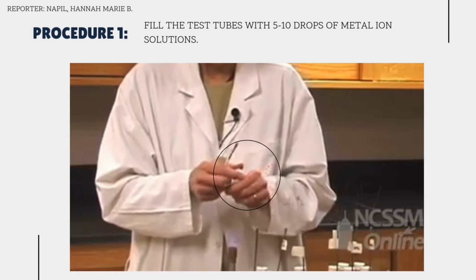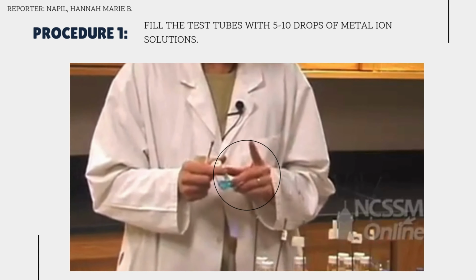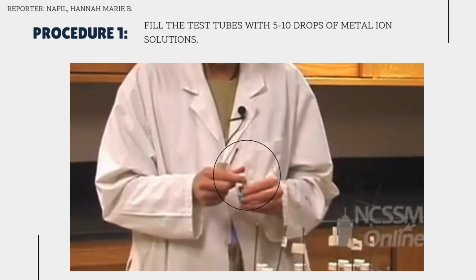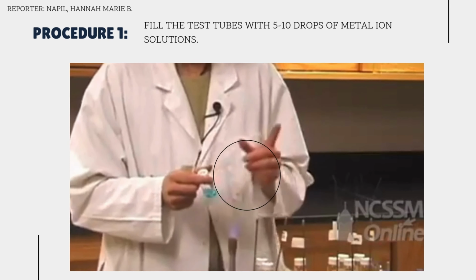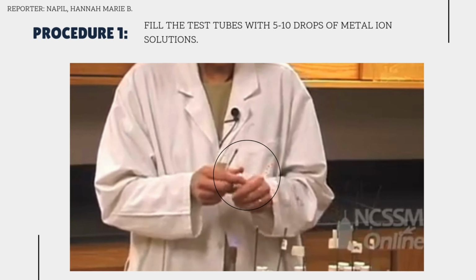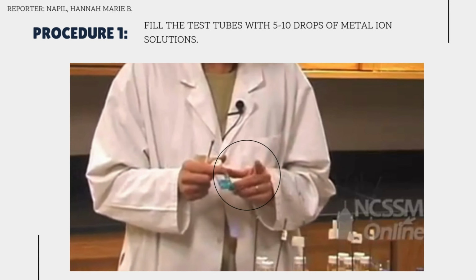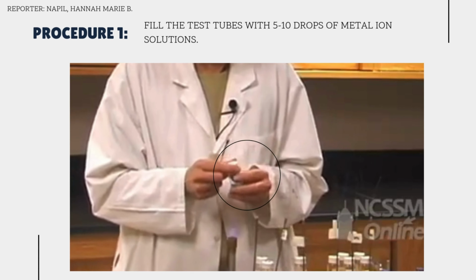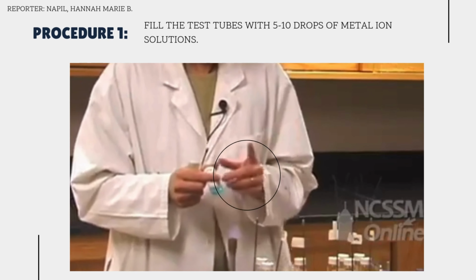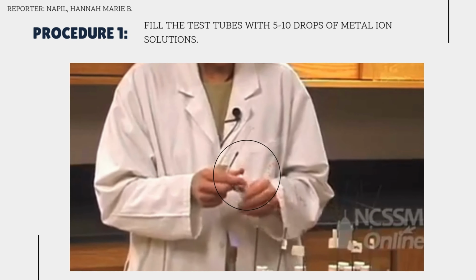Procedure 1. Fill the test tubes with 5 to 10 drops of metal ion solutions. Why 5 to 10 drops? When we do a flame test, we want to see a clear color. If we put too little liquid, the color might be too faint to see. If we put too much, the flame might be too strong and hide the color. So 5 to 10 drops is just right. This way, we can easily identify the metal in the liquid by the color of the flame.